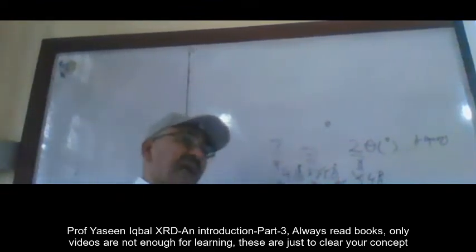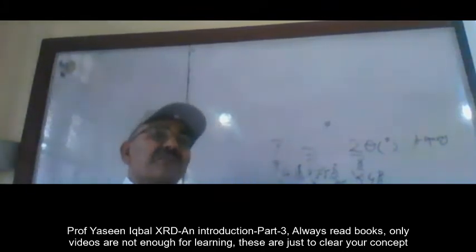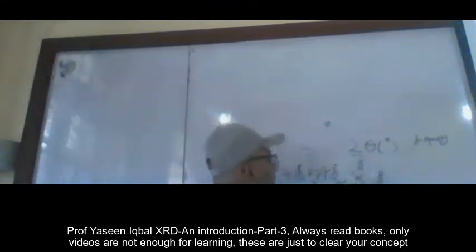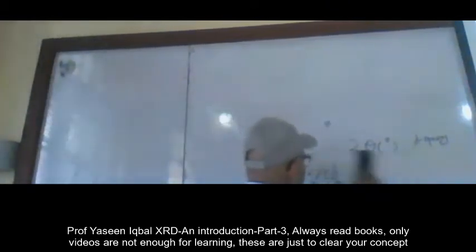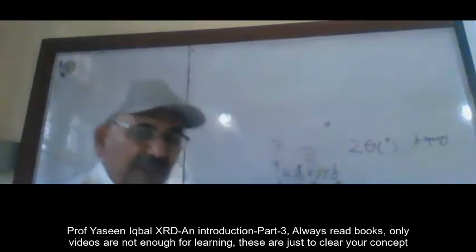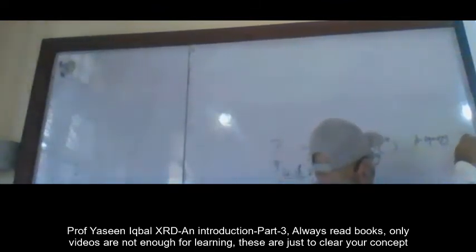So when you order it, you label it, and then you ask for the list in the form of a table, it gives you this table: 2 theta and I over I naught.